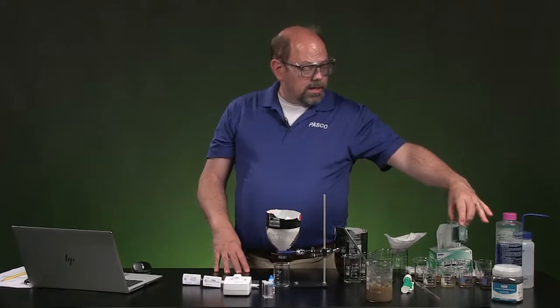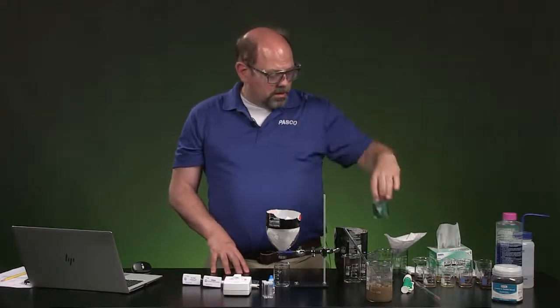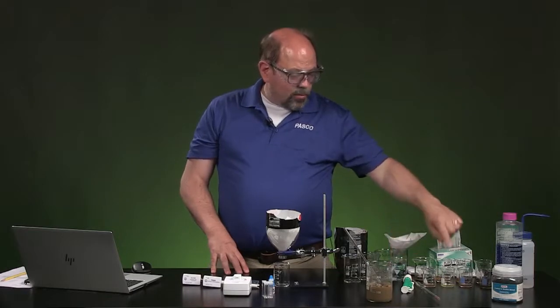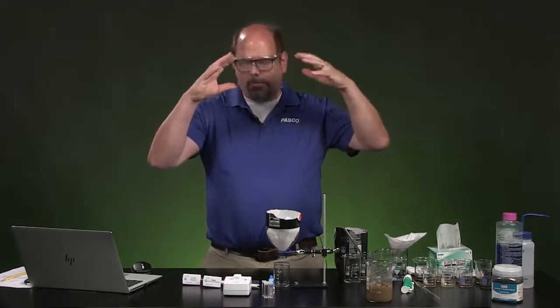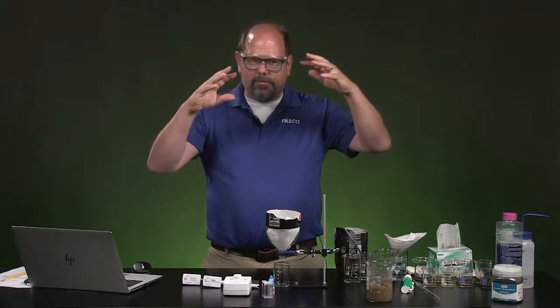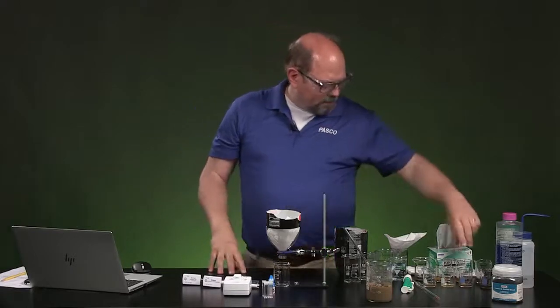I've taken the concentrated version and made it 4 parts per 100, 4 mils in a 100 mil sample, and we can put that into that water and see what that does. It's supposed to create small molecules, actually bigger than molecules, sort of particles that make a flocculant. It looks feathery, and that'll grab some of the materials and bring it down to the bottom.